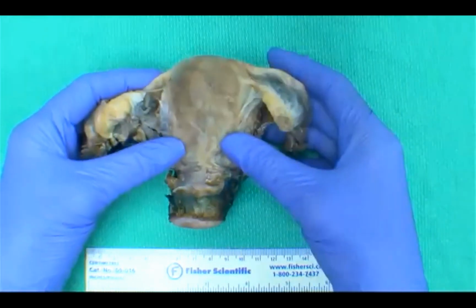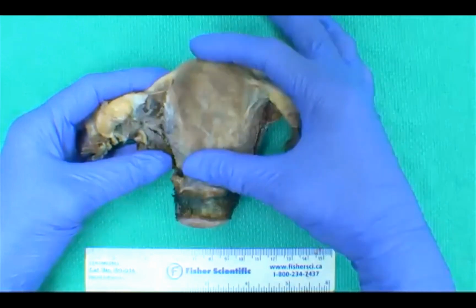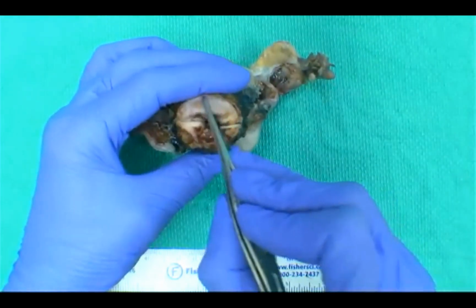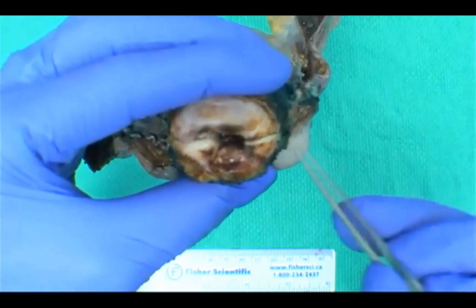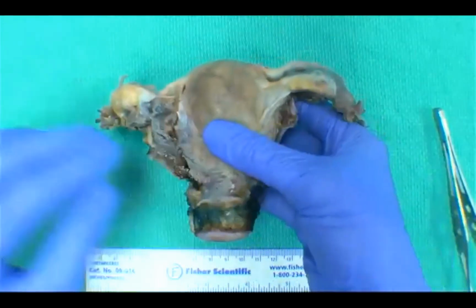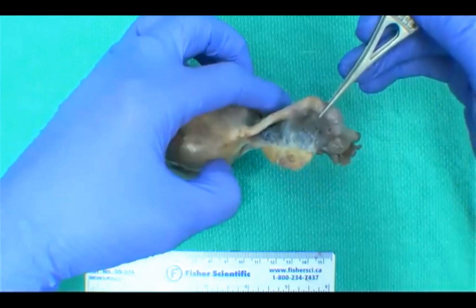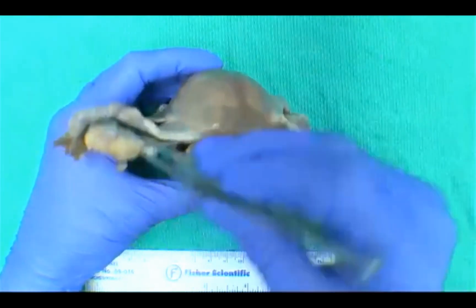So our uterus is comprised of a corpus, which is the superior portion here, and the cervix or the neck. The cervix usually houses our exocervix. Centrally, you have an os, which in this case, if you can see that in the camera, is a little bit dilated and slit-shaped. On either side of our uterus, right between my forceps, are the fallopian tubes, here and here, and ovaries.